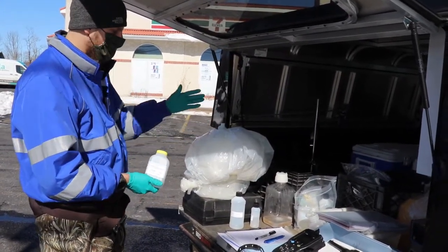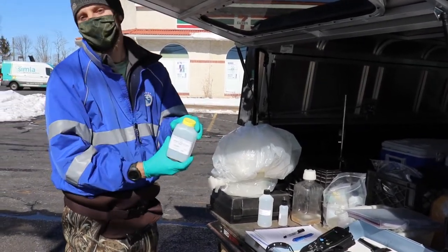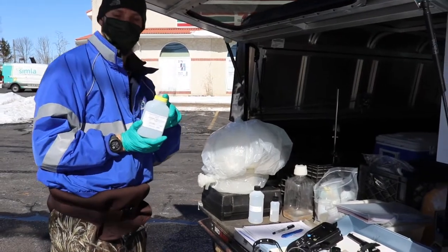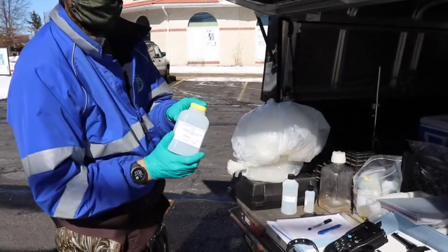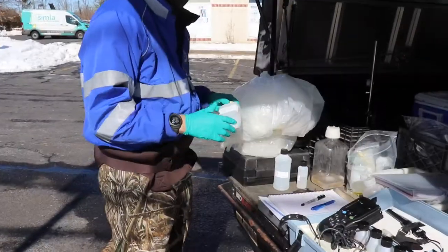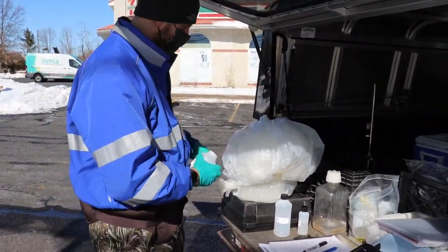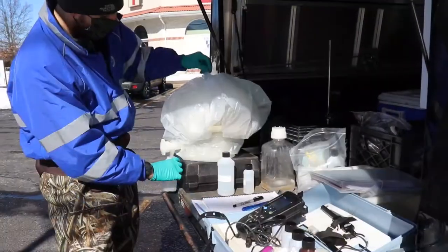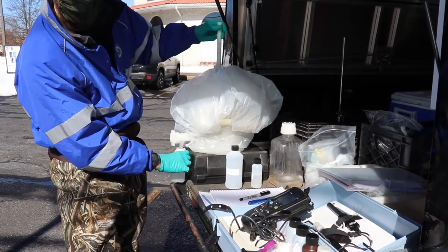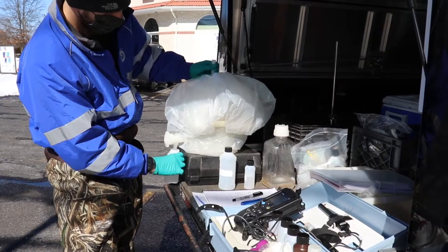The idea is that you're splitting the composite sample into different bottles. The first one we're going to do is going to DOH, Department of Health. It's coded as TSS — total suspended solids. It's going to be closely linked to the turbidity of the stream. Even while you're collecting the sample, you want to make sure that you're churning, so that you're always agitating the water and getting it all mixed.